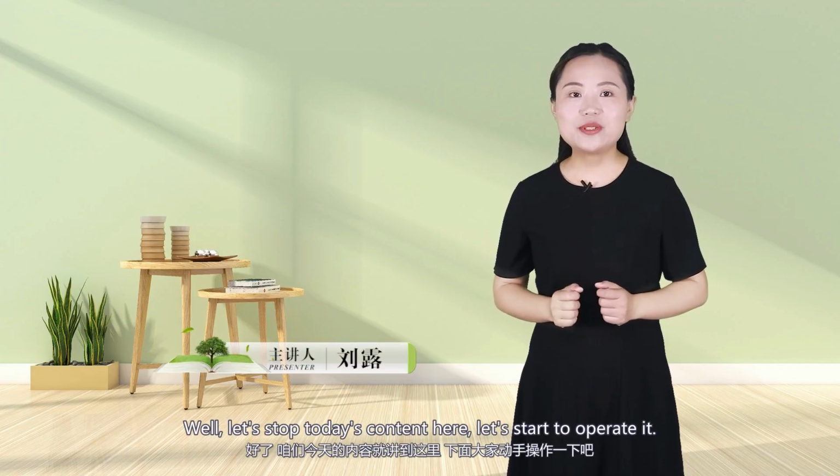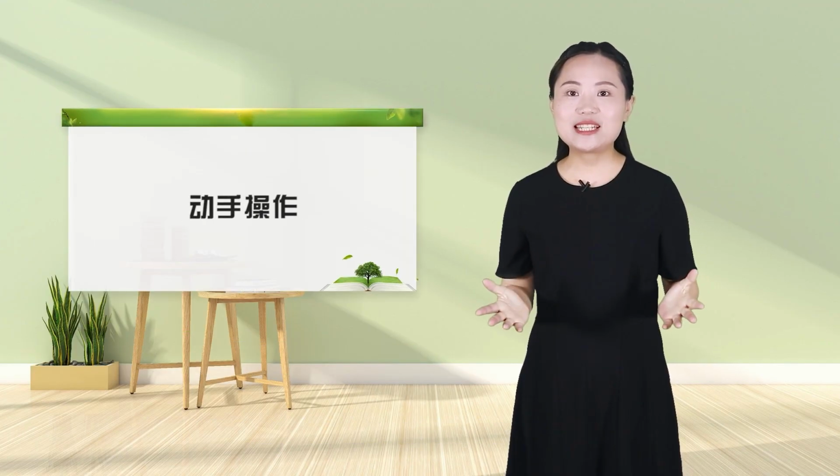Well, let's stop today's content here. Let's start to operate it.